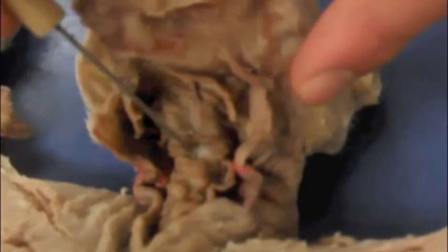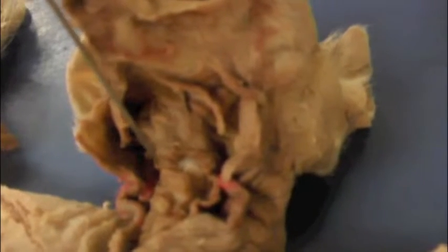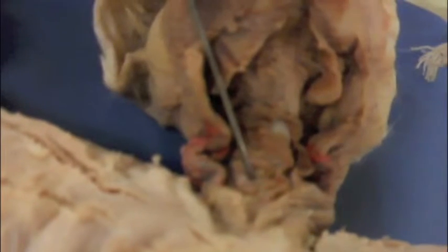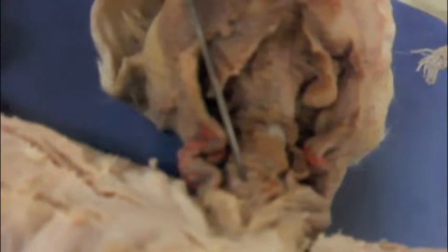The next muscle of the neck is the sternohyoid, and it's this pair here. The sternohyoid originates on the manubrium and inserts on the hyoid bone. It acts to depress the hyoid bone and depress the larynx. Laterally of that, we have the sternothyroid. The sternothyroid originates on the first rib cartilage, and it inserts on the thyroid cartilage. The sternothyroid acts to pull the larynx caudally, or towards the tail.